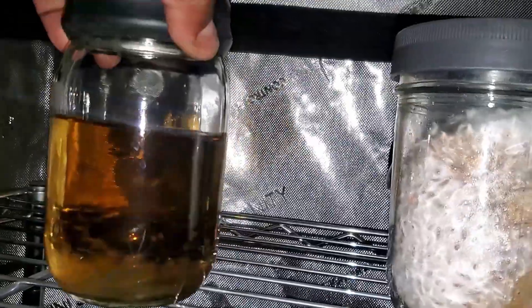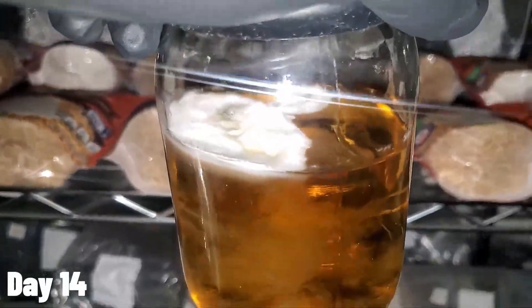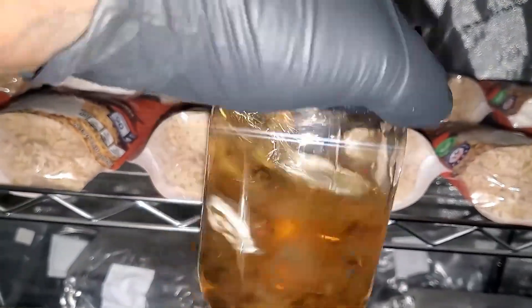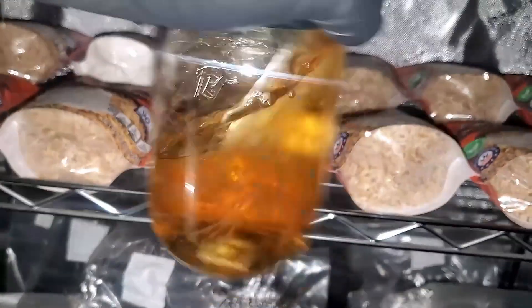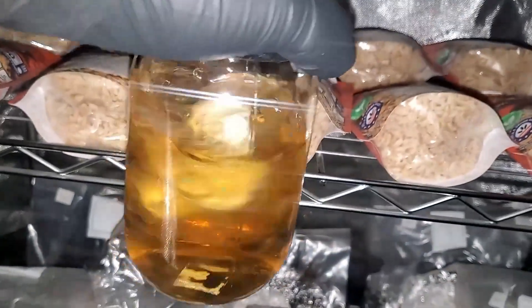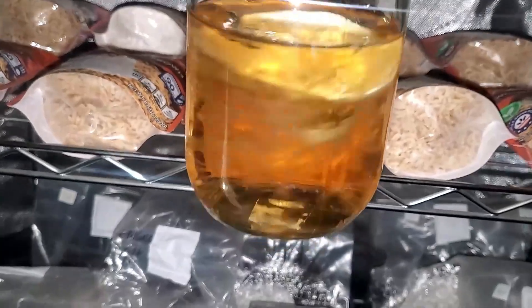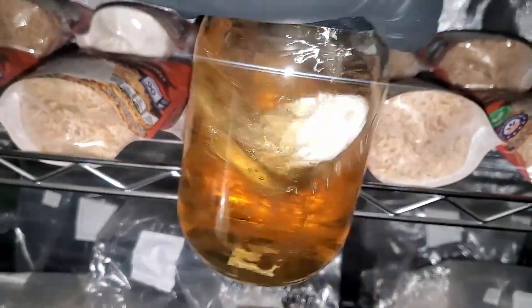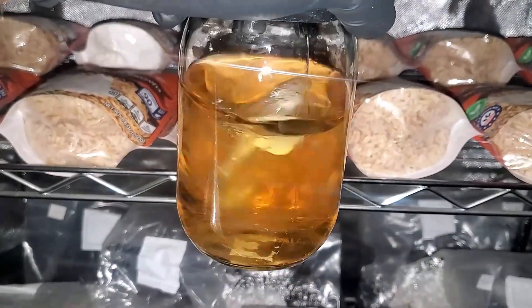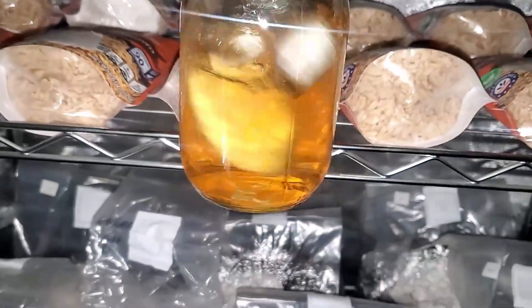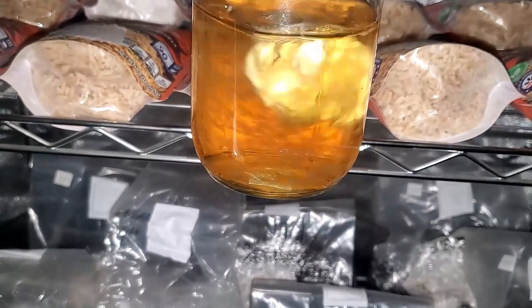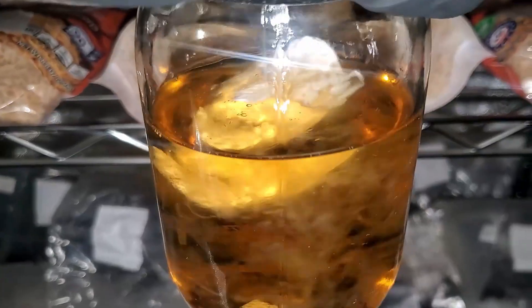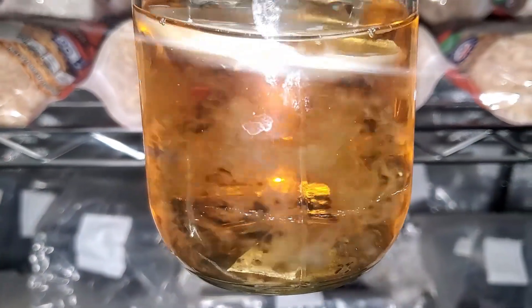All right, so now it's day 14, and if you look at the footage, you'll notice that there's like a cap of mycelium sitting on the top right there that I'm trying to break up by shaking it. I actually spent the last week on vacation. All these years that I've been a content creator, I've never taken a vacation, and I finally got the opportunity to. For the last week, I spent at a casino and resort with a lady friend of mine. When I came back, this is what I found right here. So it's very important I would tell you guys that you come back every two or three days to shake this up, that way you don't end up with a cap on the top. The more I shake it up, the more it is breaking up, and you can see that mycelium inside of the liquid. It looks very cool if you ask me.